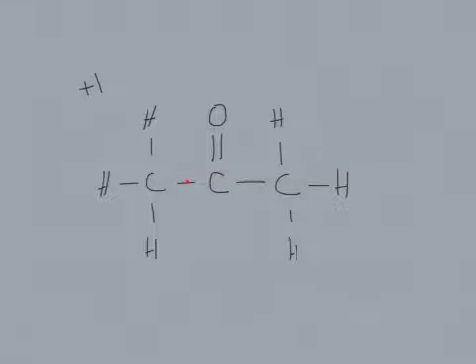Now, this has all four of its bonds filled, so we know that there's no hydrogens coming off of there, as well as from our molecular formula. So this would be 0. So our N+1 would be 0 plus 1, which equals 1, and that should correspond to the peak that we have in our graph for proton NMR, which it does.